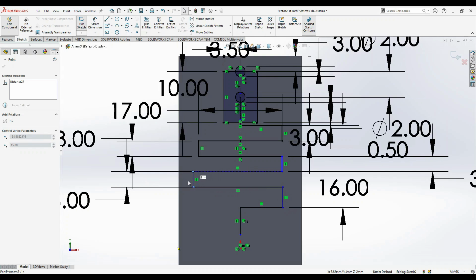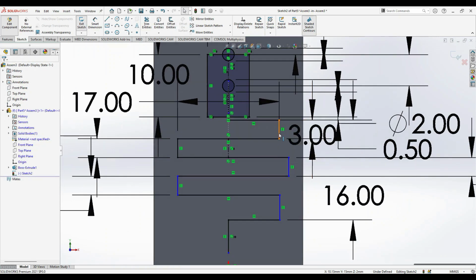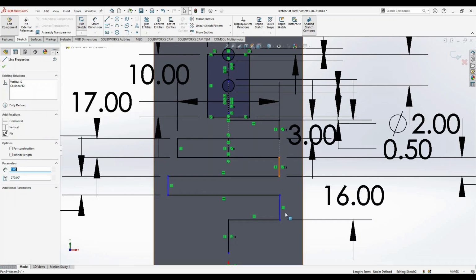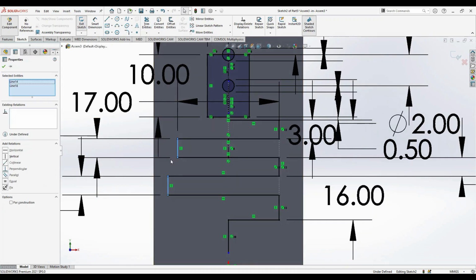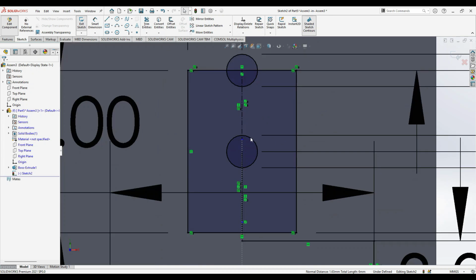And now you can see there is a constraint, like it's not fully defined in the x-axis, however the y-axis is completely constrained. So to do this, you just go to this line and select this line and make both collinear, and the same with this line and this next line, make it collinear. And the left line and the left line, make it collinear. So now you can see the formation of a completely defined sketch.